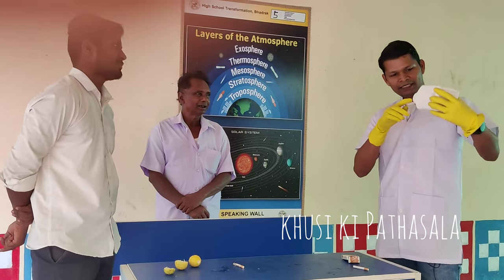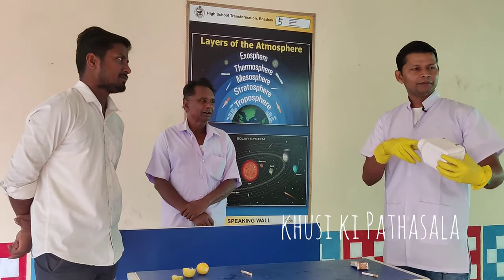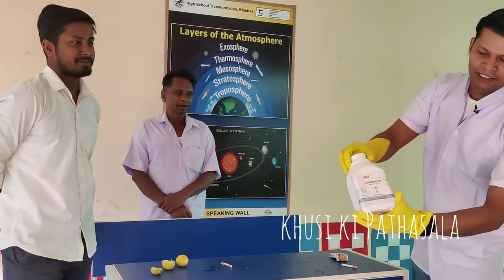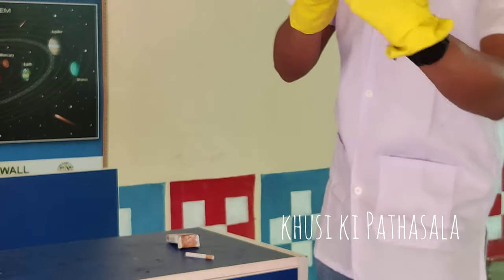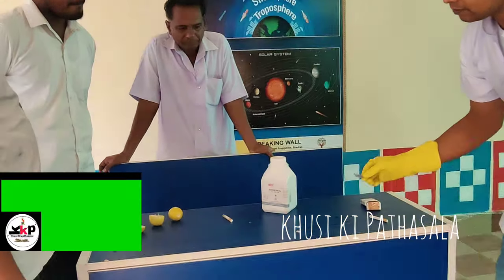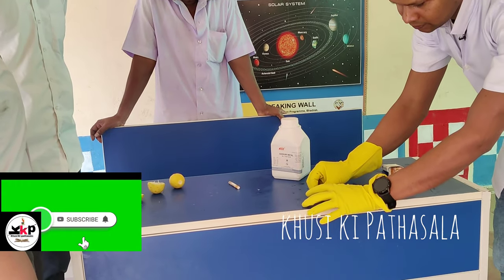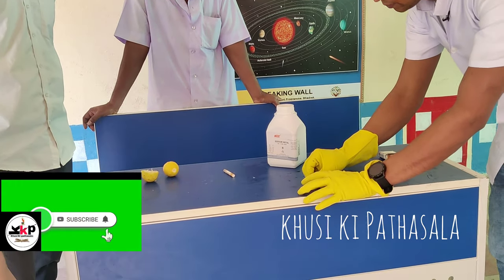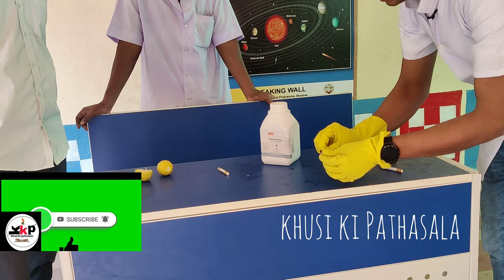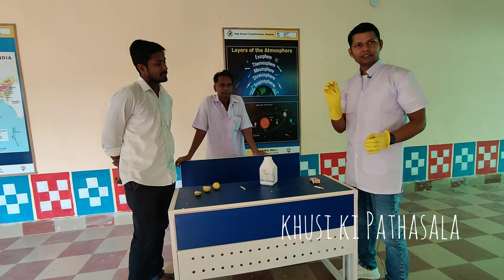I have to use this sodium metal. This is sodium metal. This is a small amount of sodium metal — just a little amount.